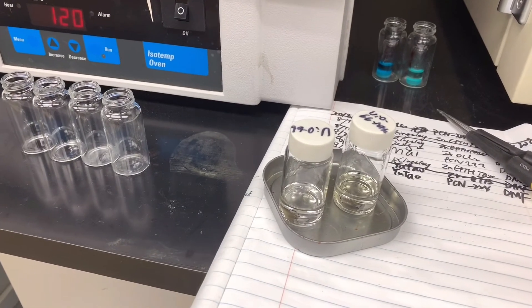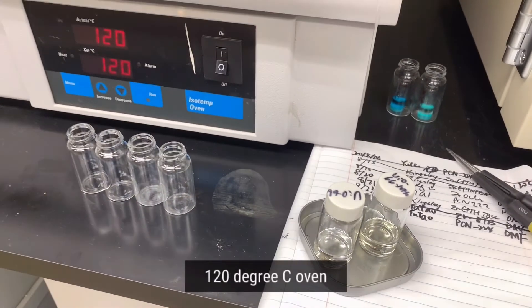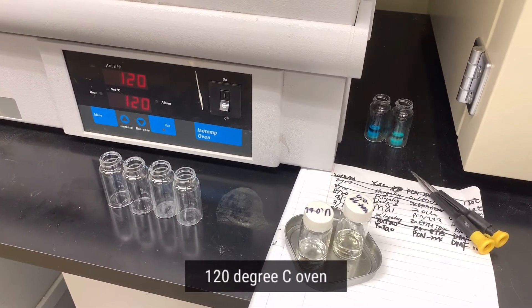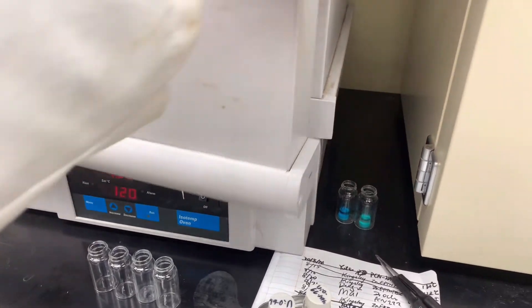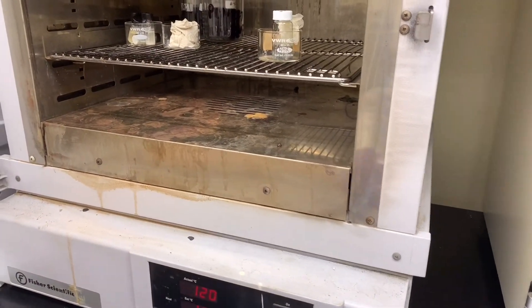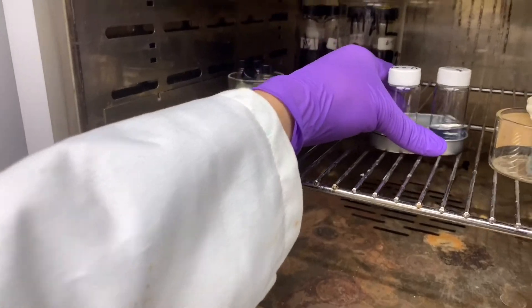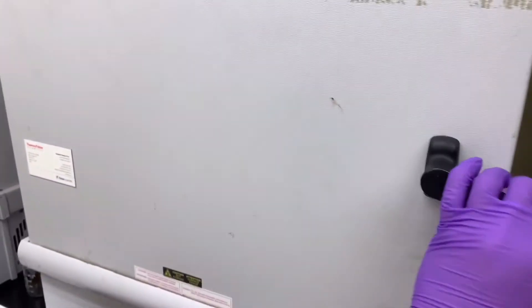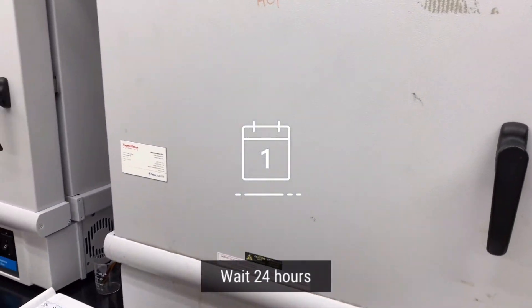Our next step is to put the vial into a secondary container and place it into the 120 degree Celsius oven. Then we need to wait 24 hours.